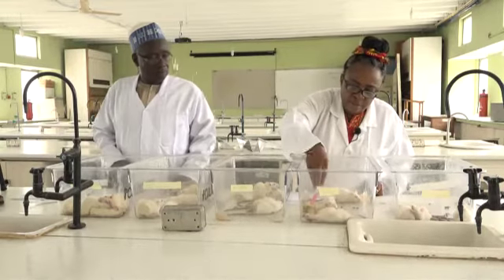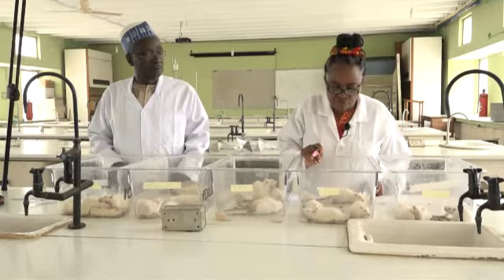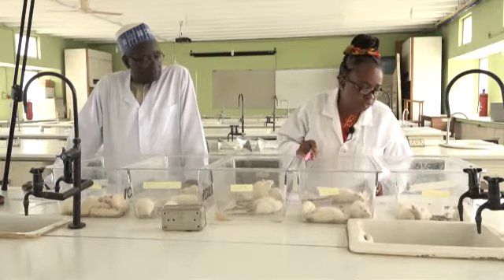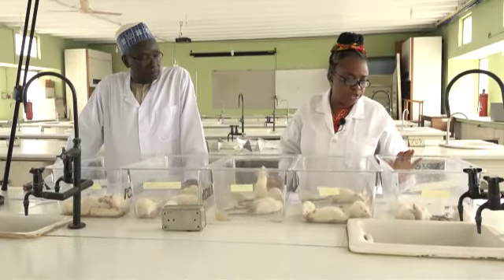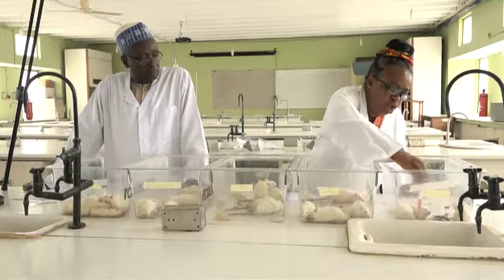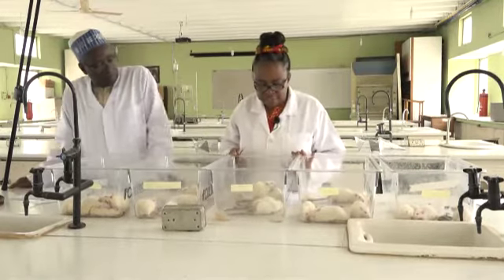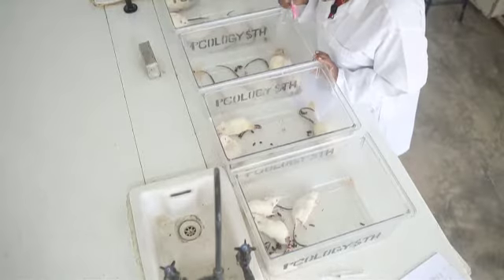Look at normal rats that receive no poison and no treatment. In this female cage that was poisoned, one rat has died, but others are showing various degrees of poisoning. In this male cage that was poisoned, 2 rats have died.